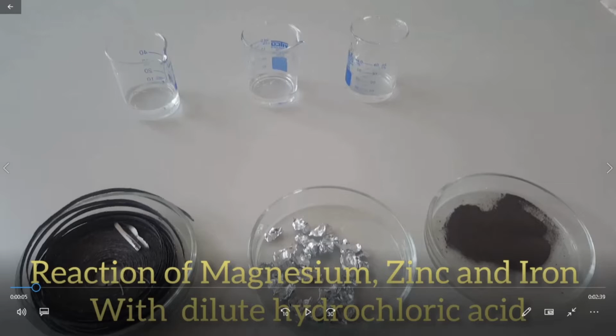For that purpose I have taken these three metals, and as you know magnesium is available in the form of ribbon. So we need a small piece of magnesium metal from this ribbon piece. Now zinc is available in the form of zinc granules, and iron I have taken here as iron powder. So let us see how this reaction is going to happen.